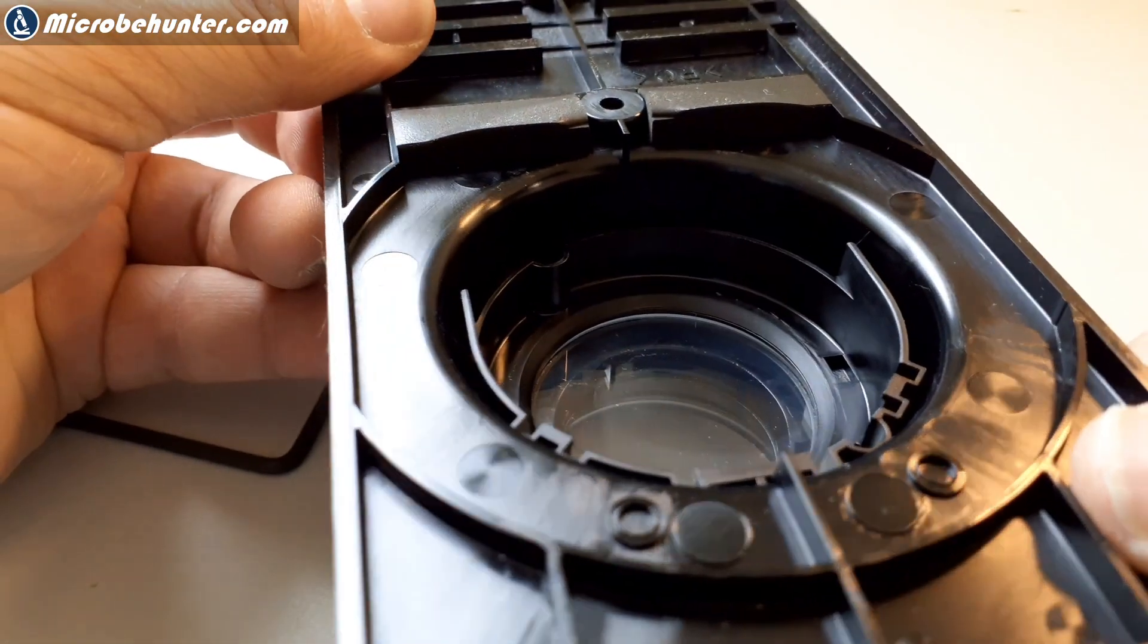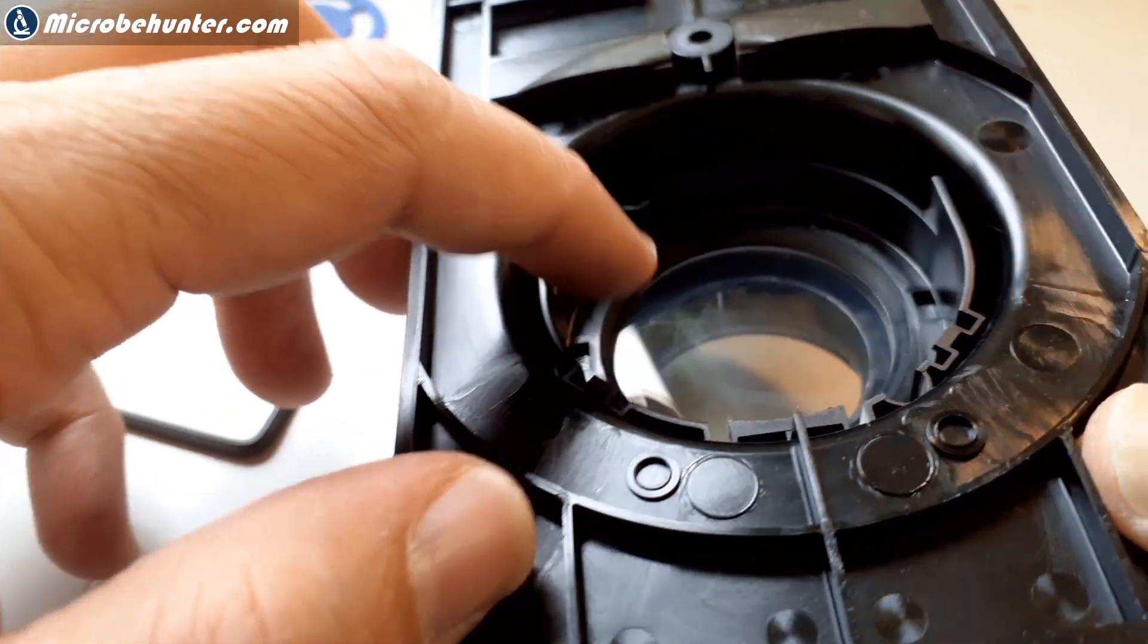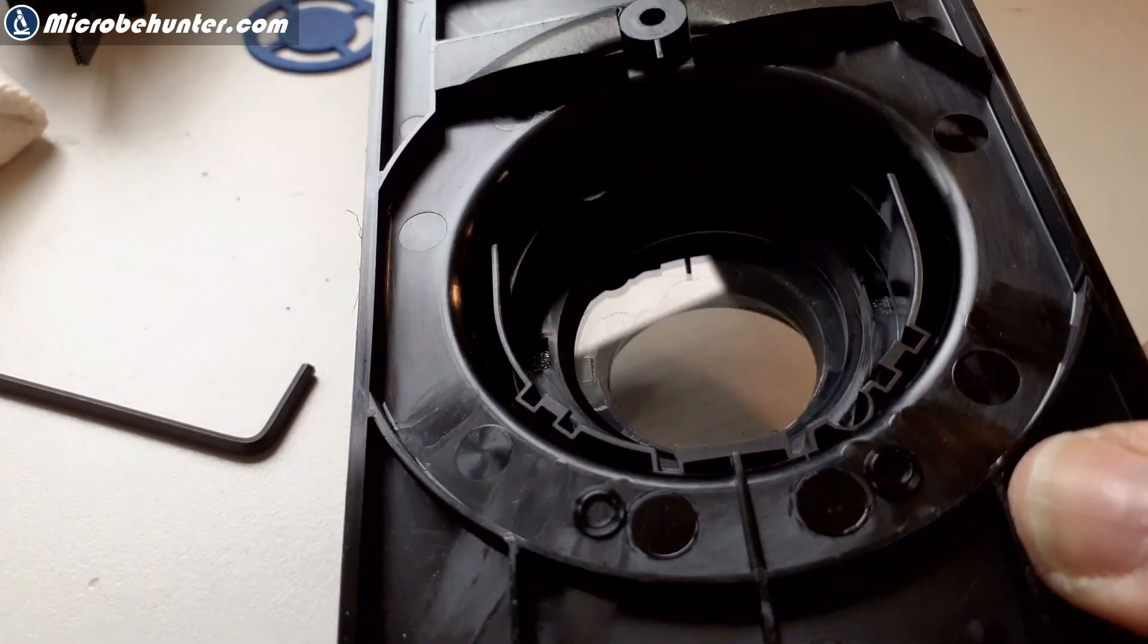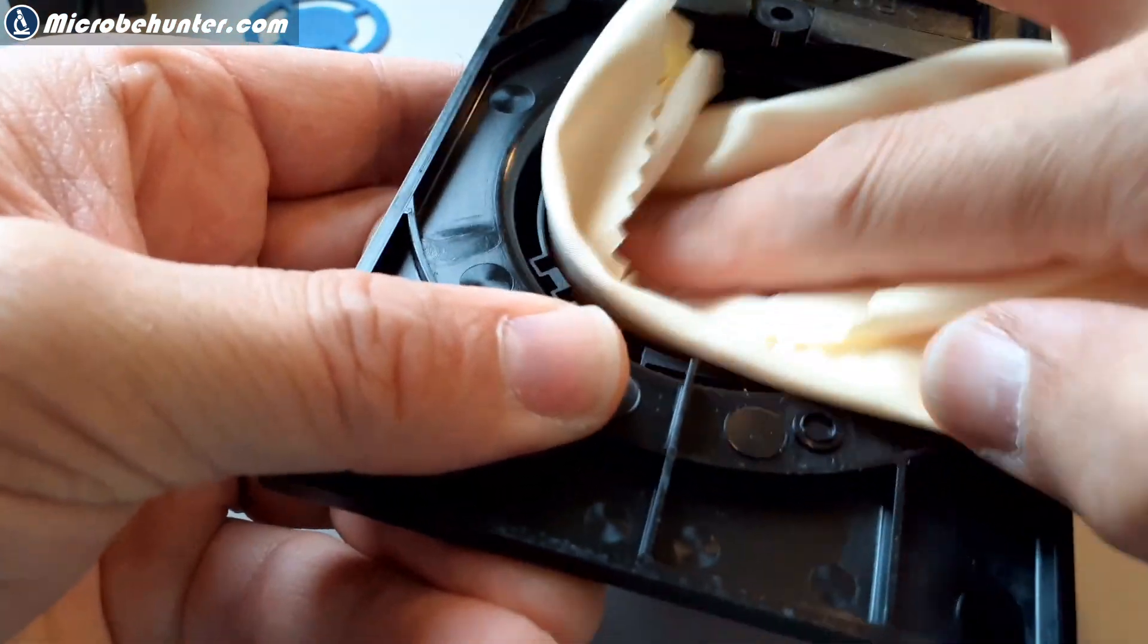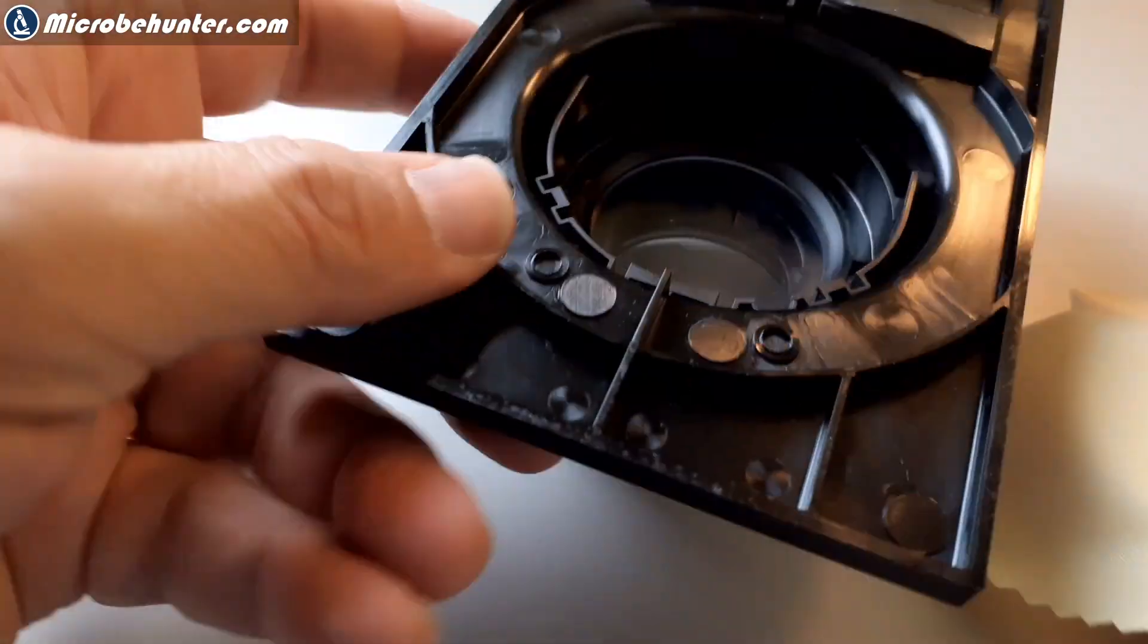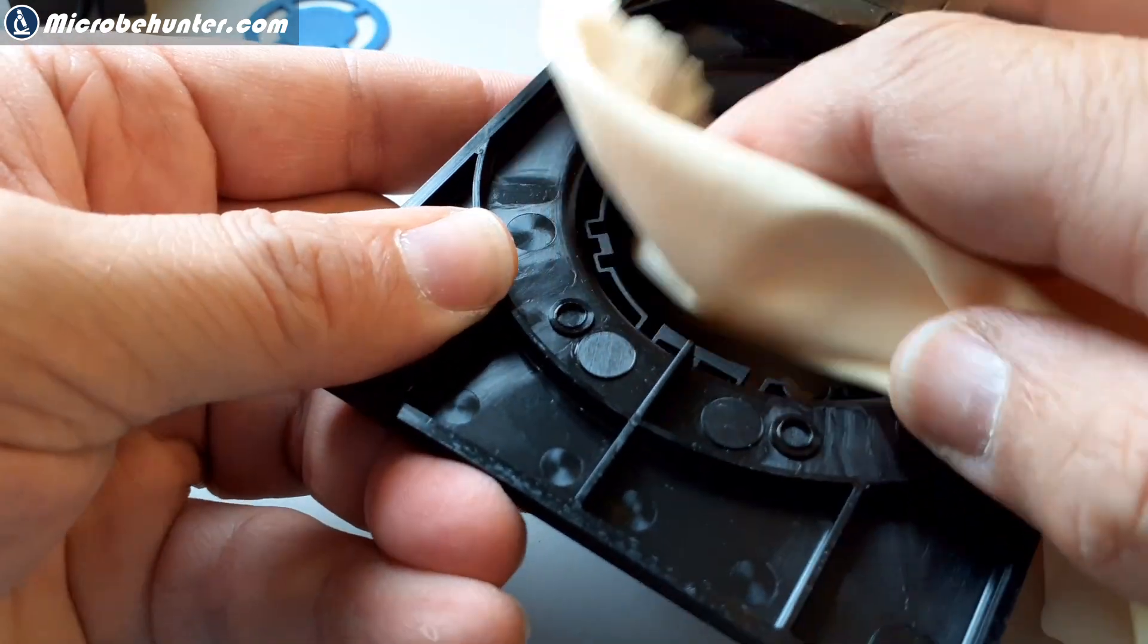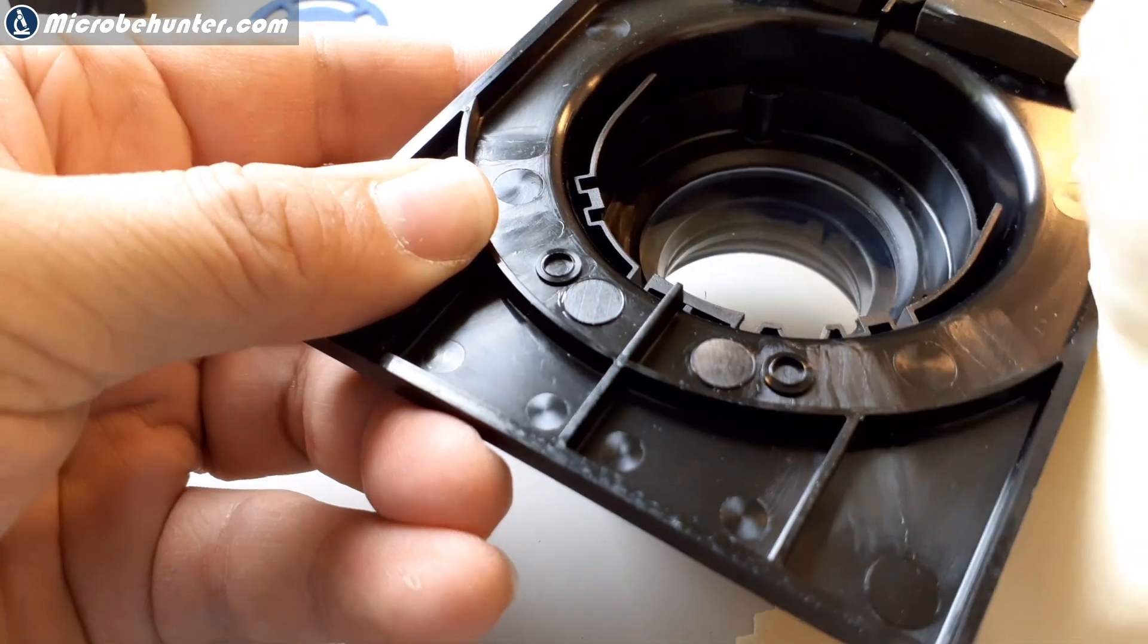Again, that's not grease. That is actually the dust that I've pushed together. Now it's a little bit better visible. So I had to use some kind of a cleaning tissue to remove all of that. That's basically what I've done. This greatly improved the situation. But when I held the whole thing again against the light, I still saw that there was still a lot of dust present inside between the glass plates.